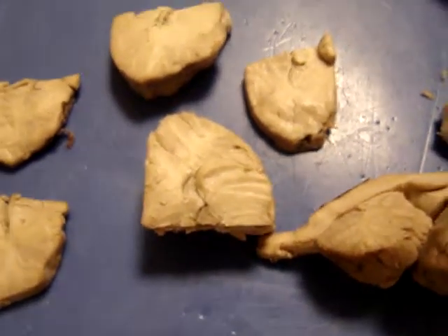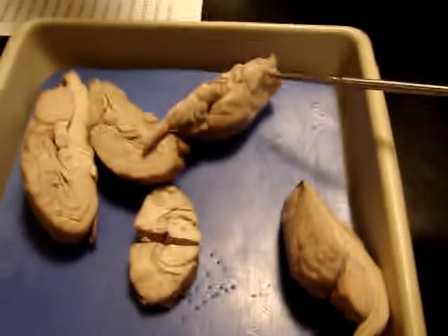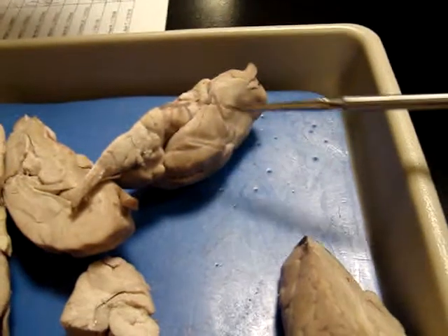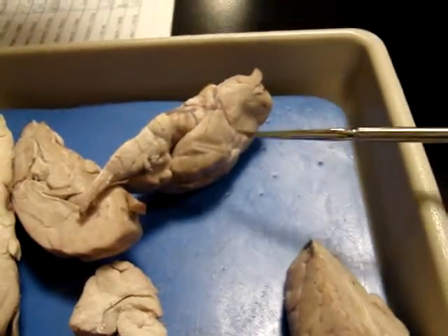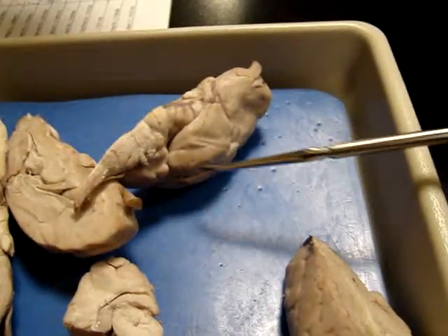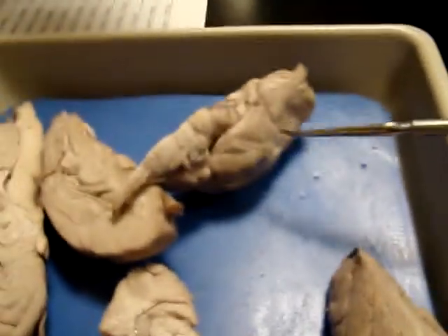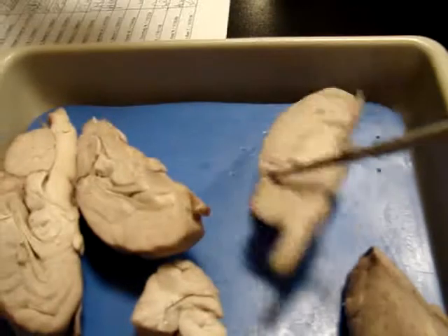Okay, so I think those are all the... And then olfactory tracts. You guys got the bulbs and the tracts. See where the tracts go back right here? So the olfactory cortex that processes olfactory information is back in the medial aspect of the temporal lobe. Okay, so that's where olfaction sensation occurs, perception of it.